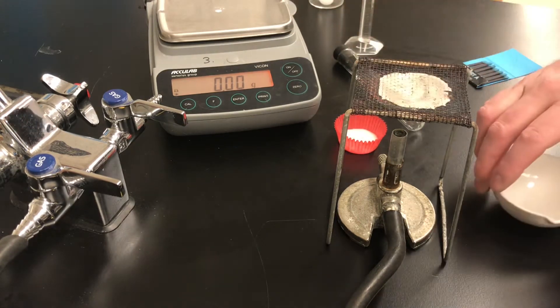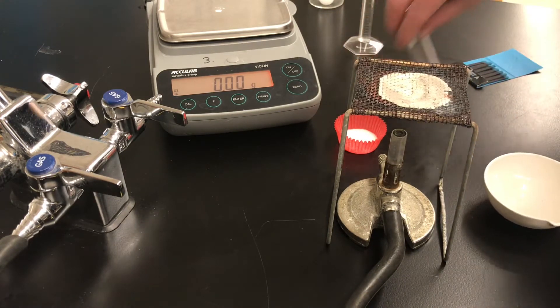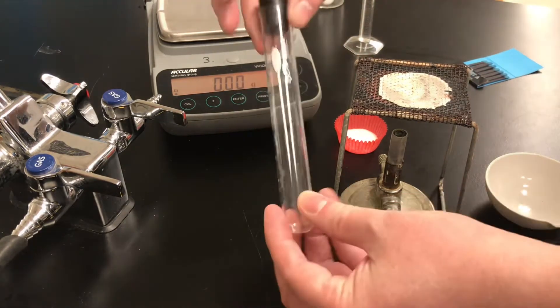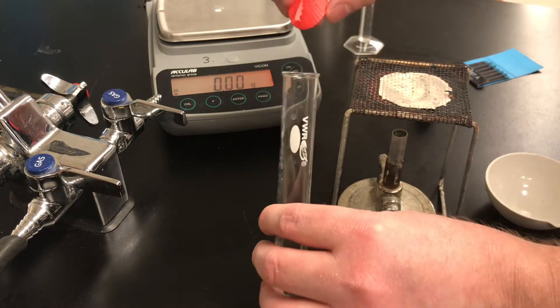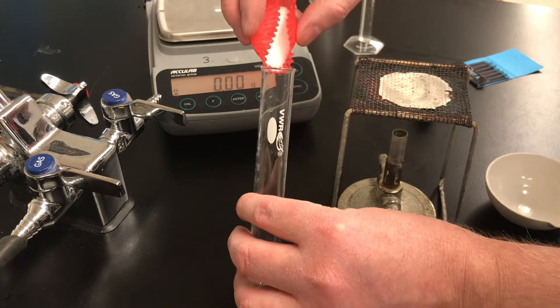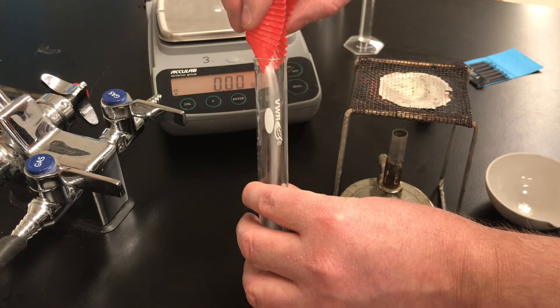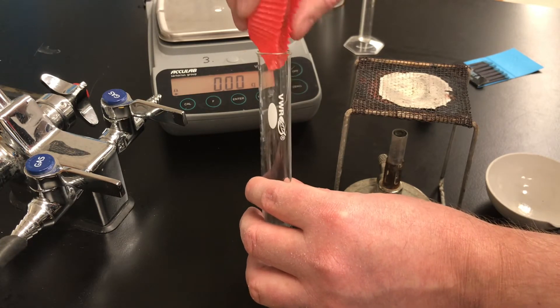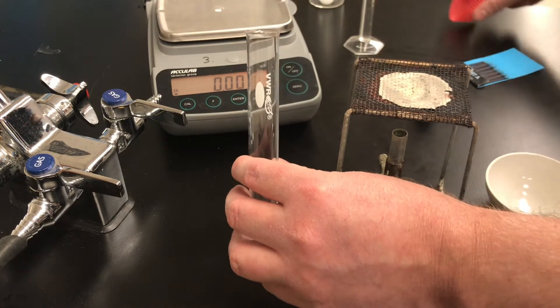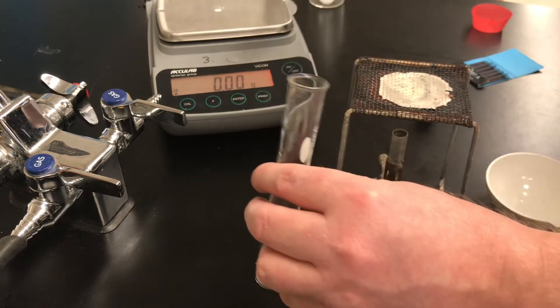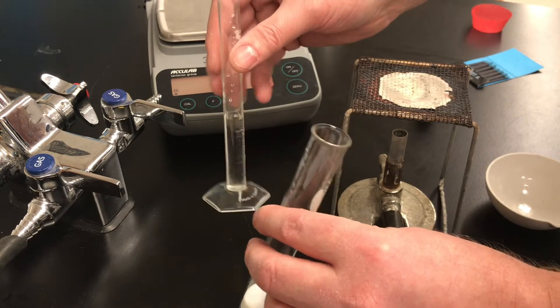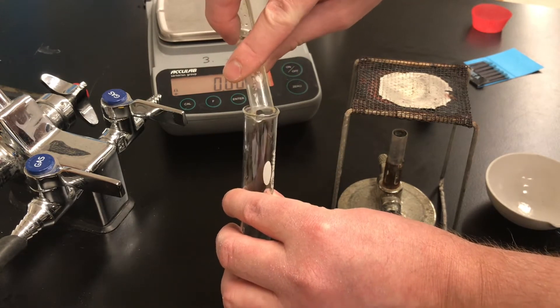Now we need to make a saturated solution. I have a test tube and I'm going to pour all of the salt, sodium chloride, into that test tube. The sodium chloride is our solute. The solute is the substance that you're going to dissolve and we're going to add the solvent, in this case the water, so about five mils of water.